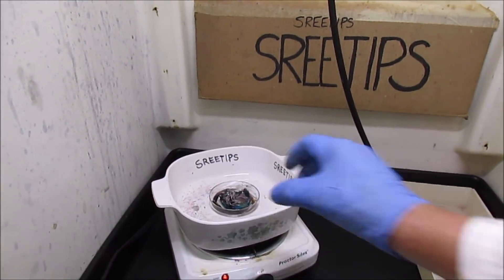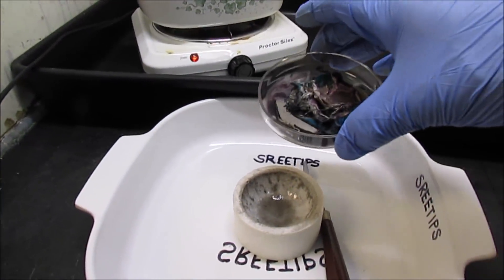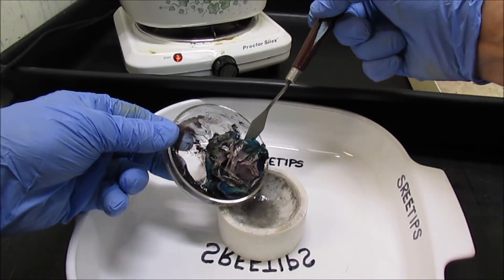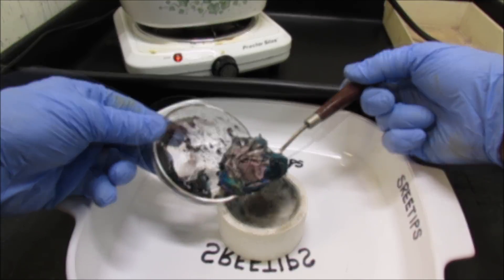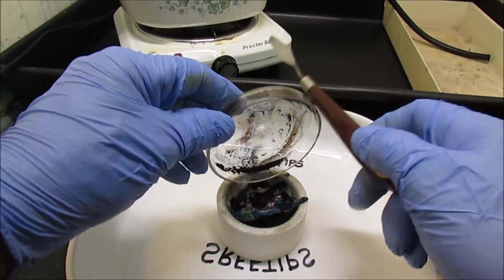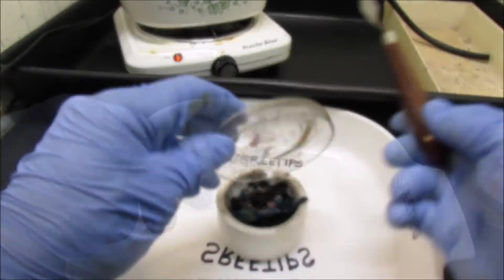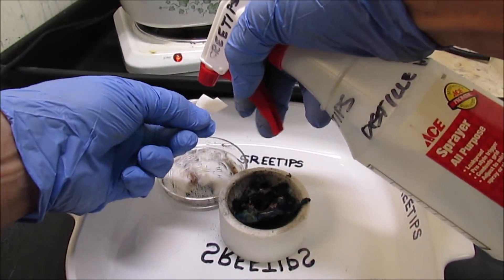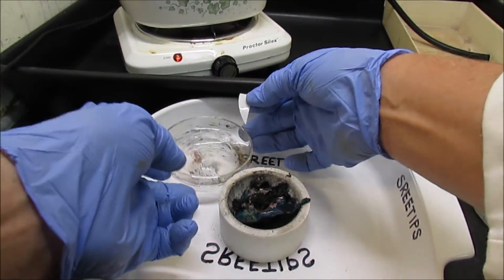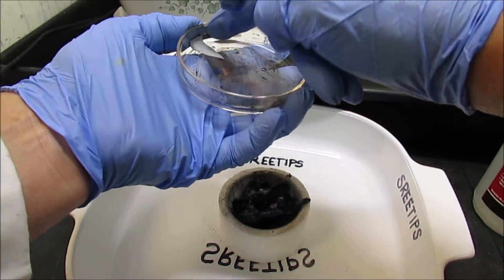The dish has been allowed to cool down to room temperature now, so what we'll do is go ahead and transfer this into a melt dish carefully. I'll use a few pieces of moistened filter paper here to go ahead and rinse or wipe the remaining palladium out of the fused quartz dish and get that down into our crucible.